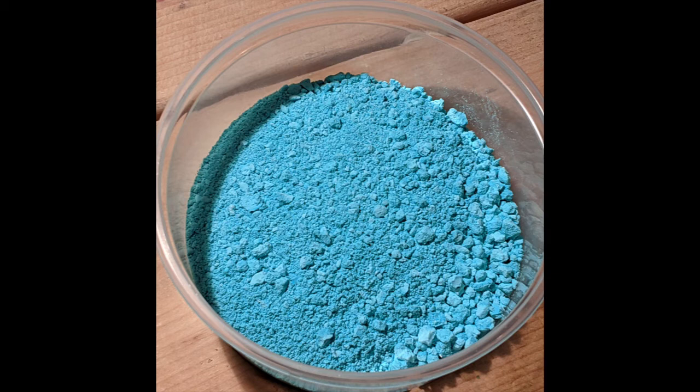The yield is about 48.634 grams, which is much higher than expected, but this is possibly due to the powder being still a little wet.